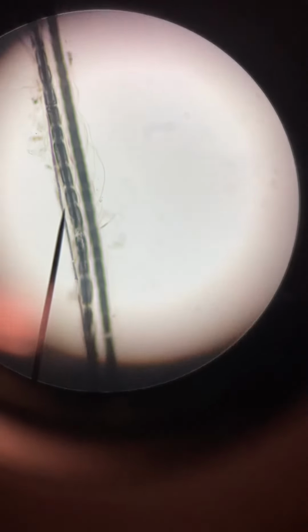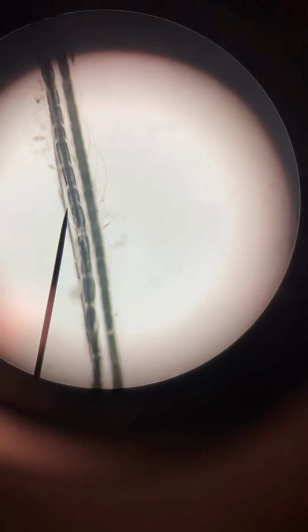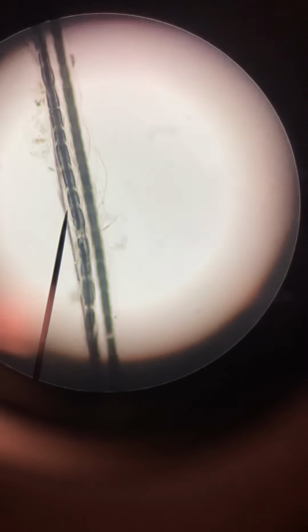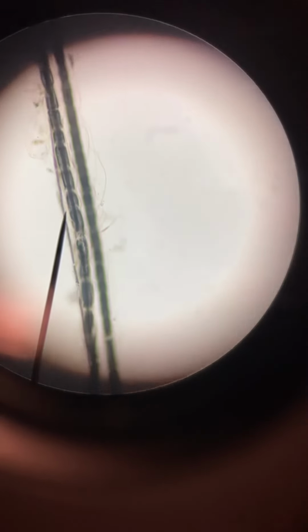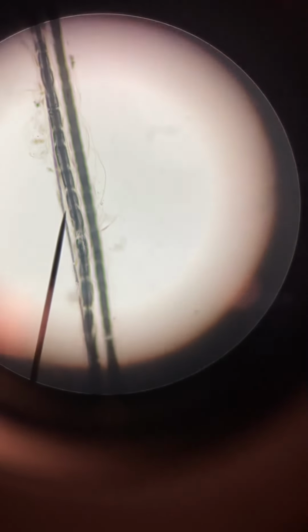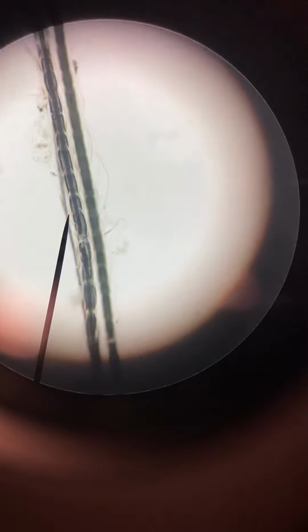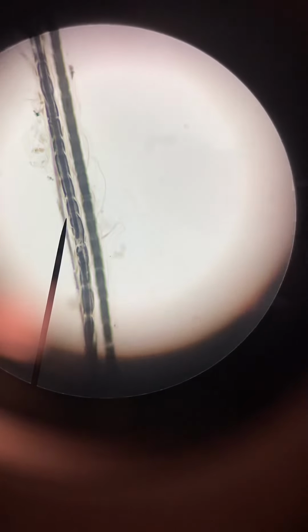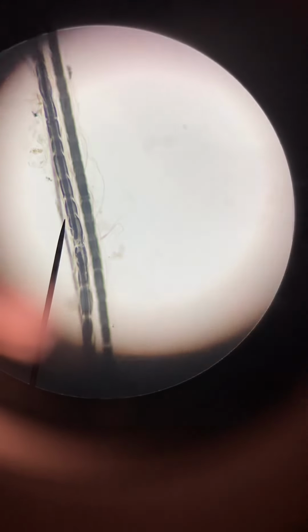And in this one here, if I zoom in on this one the same way, we can see a long single neuron magnified 400 times. Now here, by the pointer, look inside those marshmallow-like structures. The marshmallow-like structures are the Schwann cells with the myelin. But inside the marshmallow is a dark black line. That's the axon. And where the marshmallow structures join, those are the nodes of Ranvier. It's pretty neat being able to see a single neuron magnified 400 times.